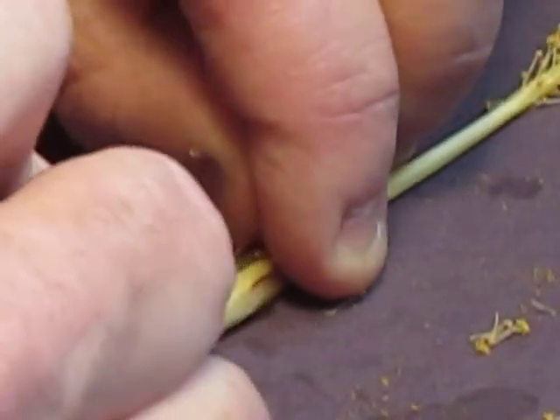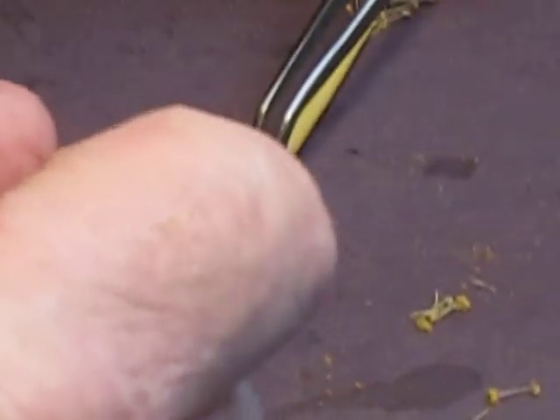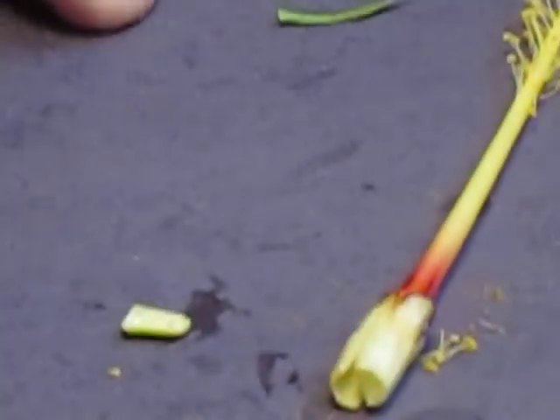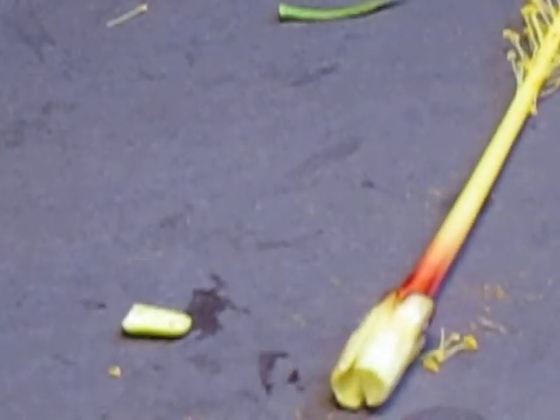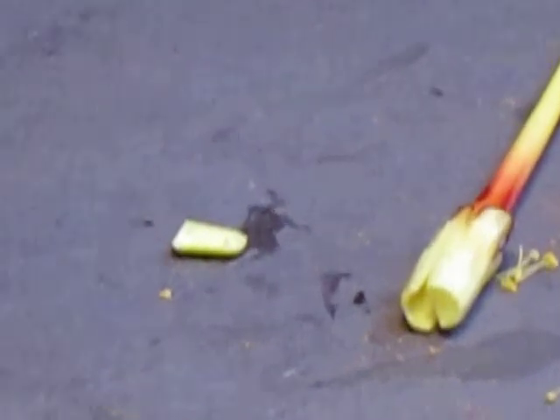I'm going to try to find what looks like the middle, and I'm going to cut straight down, and I'm going to grab my tweezers, and I'm going to pull this apart and see if I can knock out, and I did. I got very, very lucky with that. And make sure you guys can see that. It looks like you can. Move it back up a little bit, maybe zoom in just a tad bit.